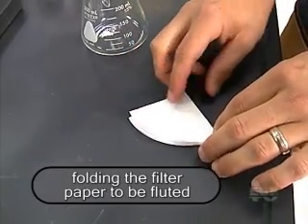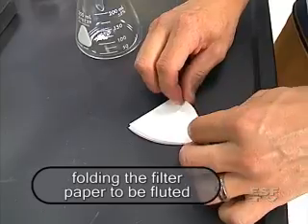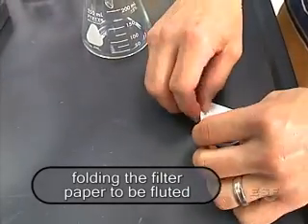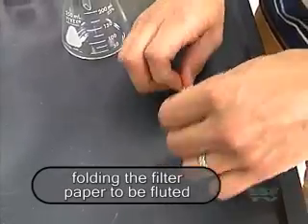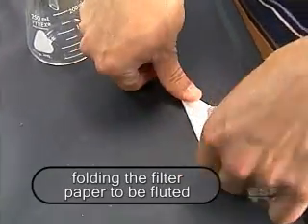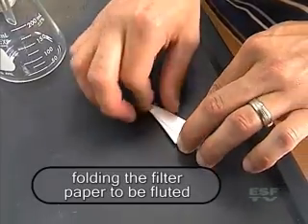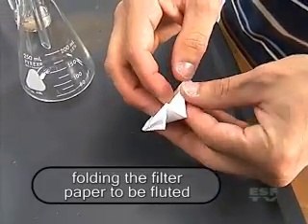Now I'm going to go through the process of fluting which is much like folding a paper fan. So I'm going to make one fold, flip it over, fold it back, flip it over, and fold it back again and lastly one more time. And again what this is doing is forming a lot of sides to increase our surface area.